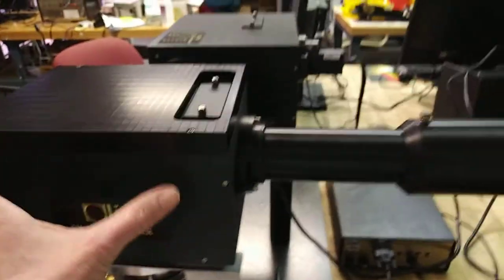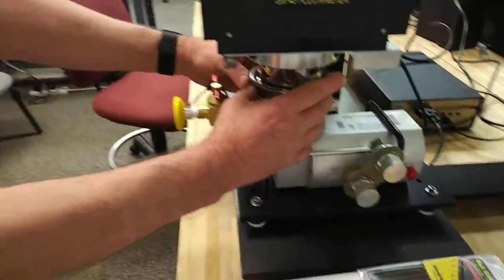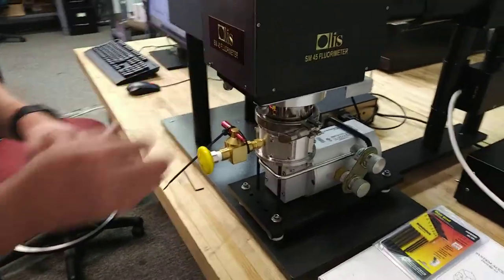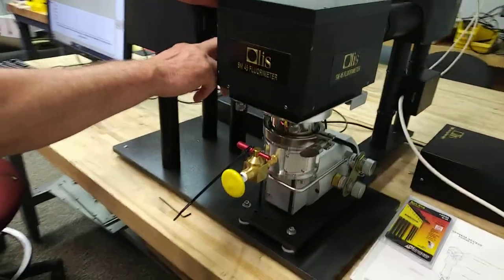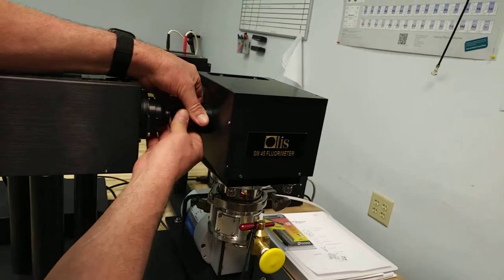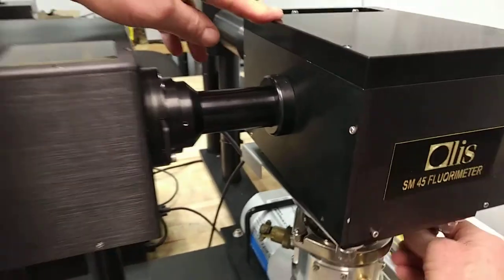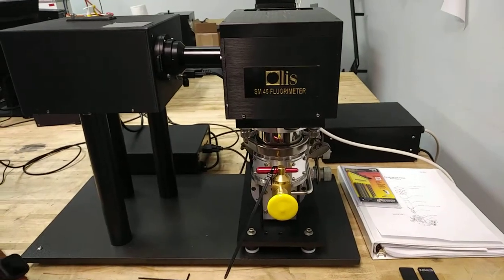When you set it down on the flange without the tubes, it can be rotated 360 degrees — wherever it can spin to. So you turn it until this tube lines up with this port, you line this up until it evenly goes on, and then you tighten the clamp up to secure it square.